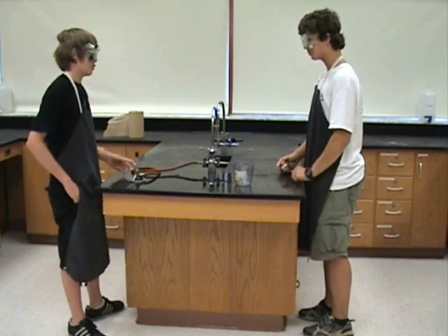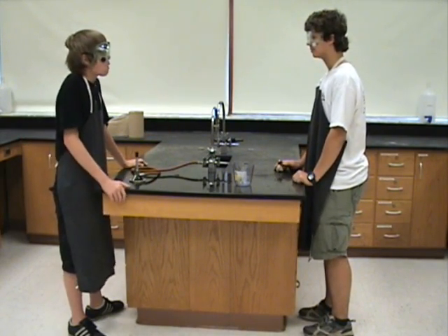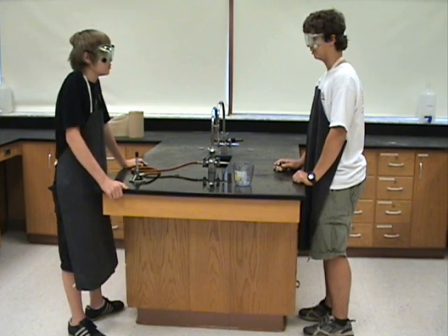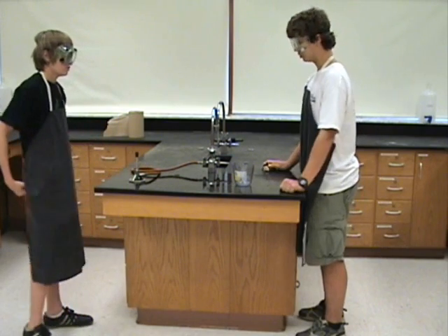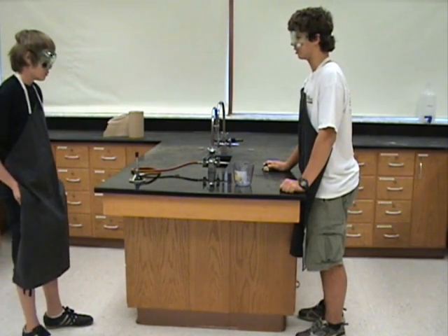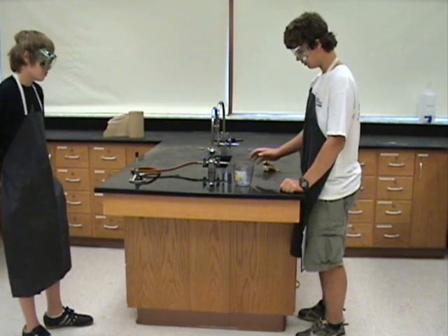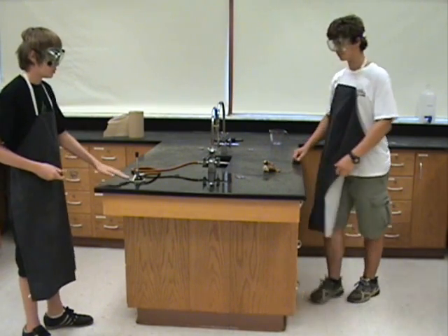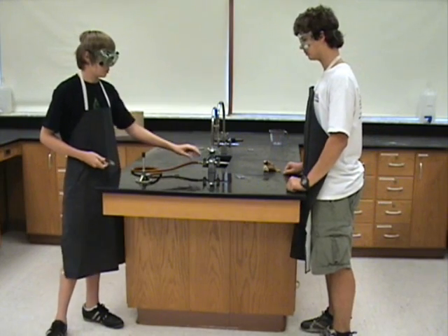Okay, now I'm gonna light my burner. Do you have a lighter on you? Do not carry lighters with you in the school, especially to the chemistry laboratory. No, I don't have a lighter on me. You should light the burner with your burner striker, but first I'm going to move this explosive liquid out of the way. Keep all combustible materials away from open flames.